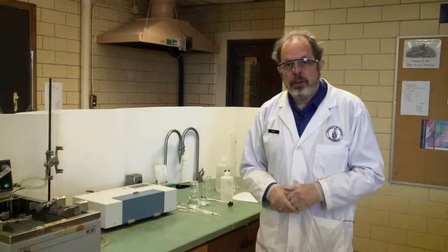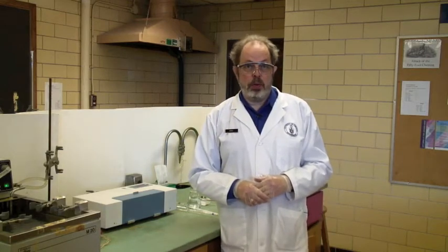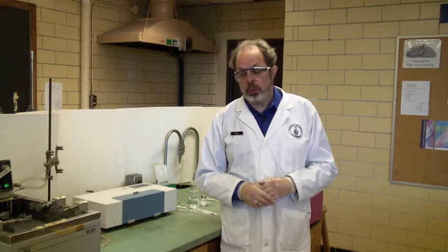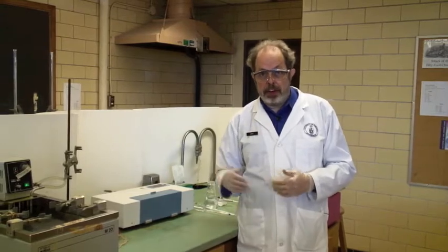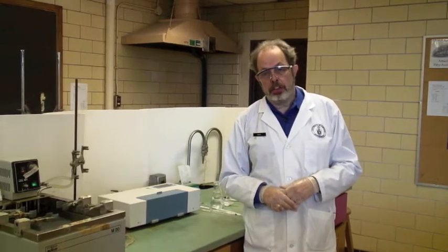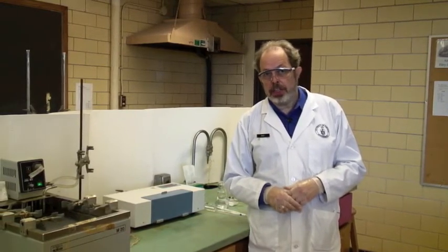This video is to show you how to operate a polarimeter and use this to do experiment K2, which is the kinetics of the inversion of sucrose at various different temperatures, monitoring it by optical rotation.